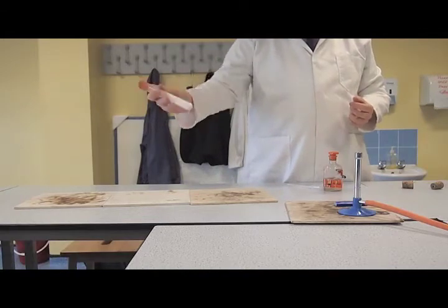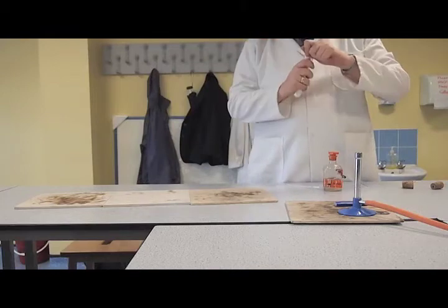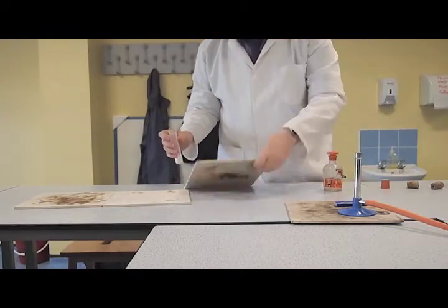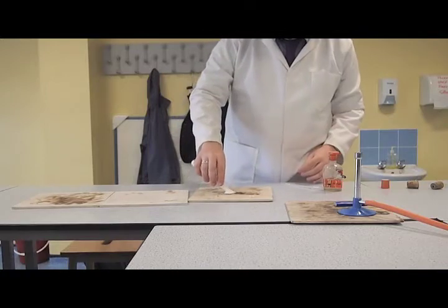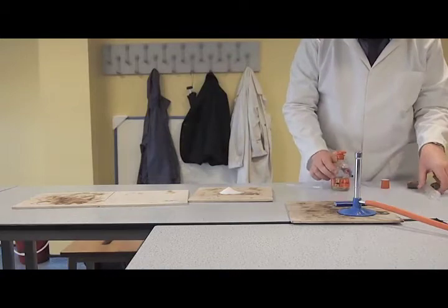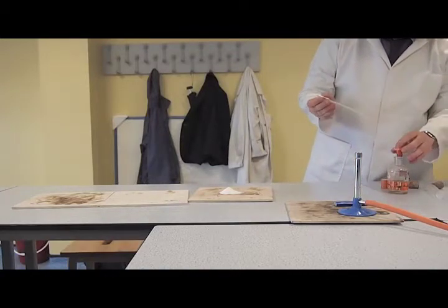Now, all I'm going to do is, I've mixed this up: potassium chlorate, sugar, and our strontium. This is the first one. So hopefully we should see a fairly vigorous reaction, and the same colour as we saw in the previous flame test. As we do with the biscuit, I'm going to get this going with a bit of acid.